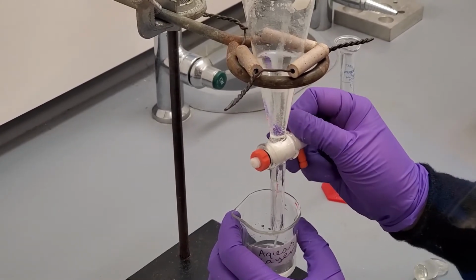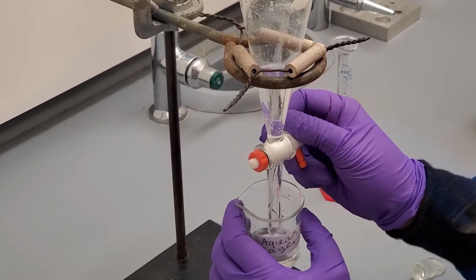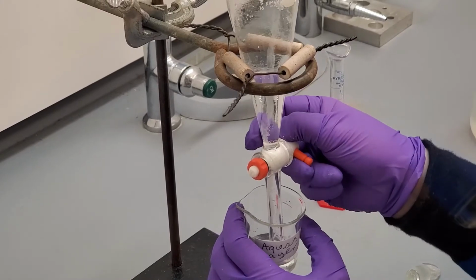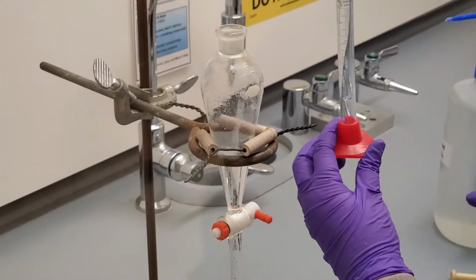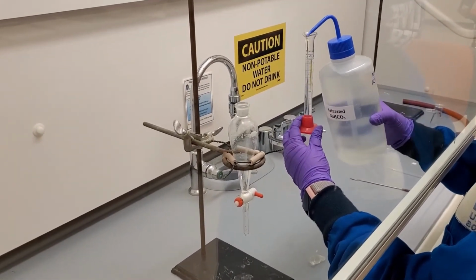As the aqueous layer drains, it will appear to move faster as the funnel narrows. Make sure to adjust the stopcock so that it moves even slower. Stop the flow by turning the stopcock back to perpendicular when the meniscus of the aqueous layer is just above the stopcock. Move the aqueous beaker out of the way to avoid contamination. Add another 10 ml of bicarb solution to the separation flask and repeat the 3 shaking and venting steps.